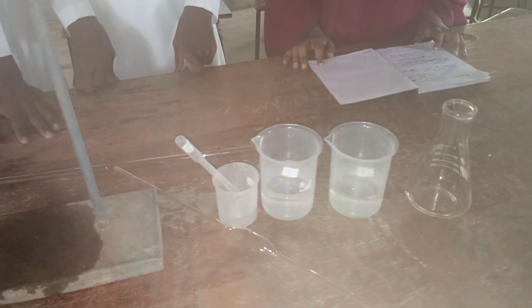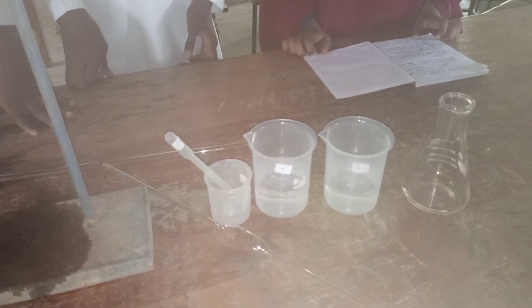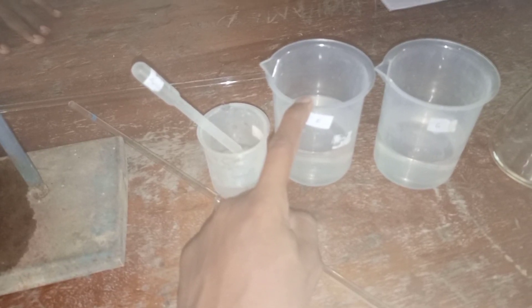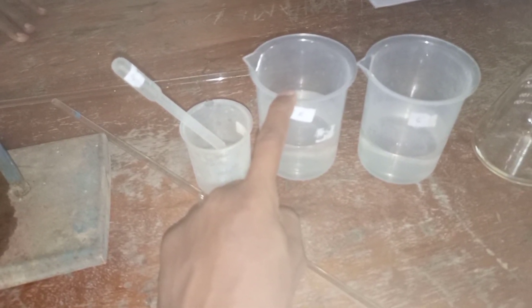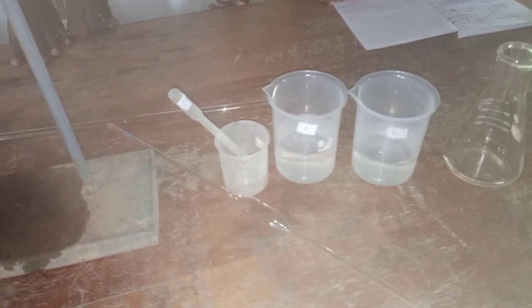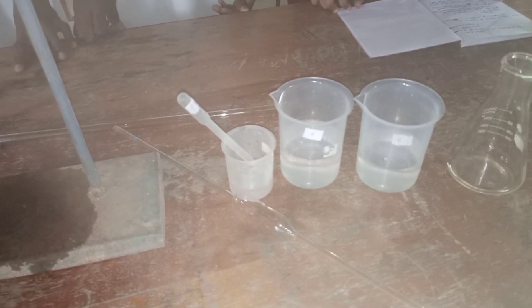The aim of this practical is to determine the concentration of solution E, which is hydrochloric acid, in moles per liter. Here we have some students who will be performing the practical for us.